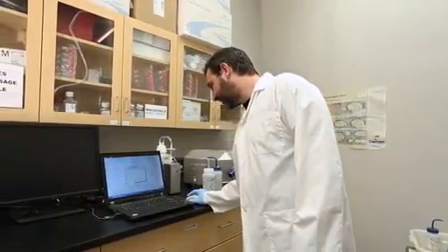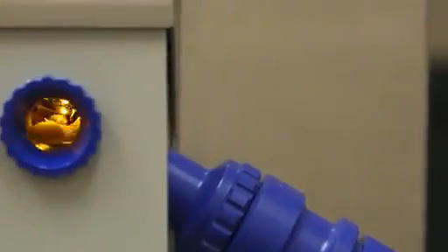For this experiment, we will use a high-resolution respirometer. This instrument measures real-time oxygen concentration in two milliliter glass chambers equipped with polarographic electrodes.